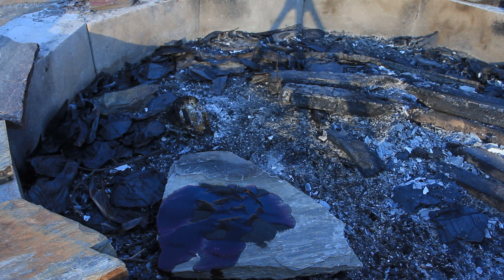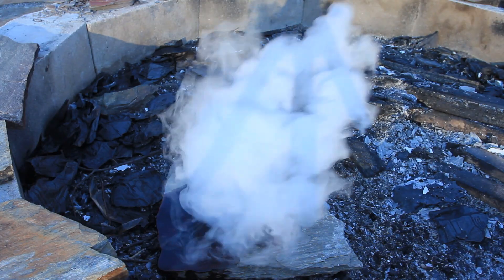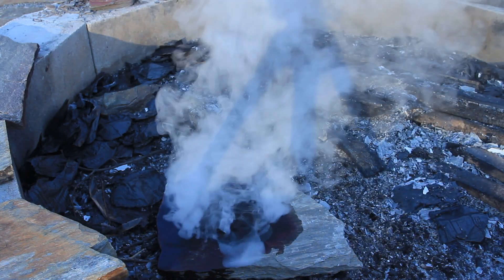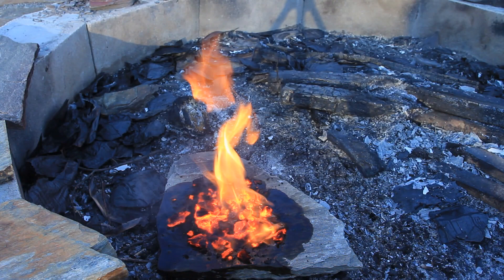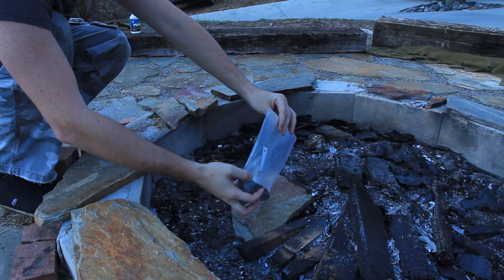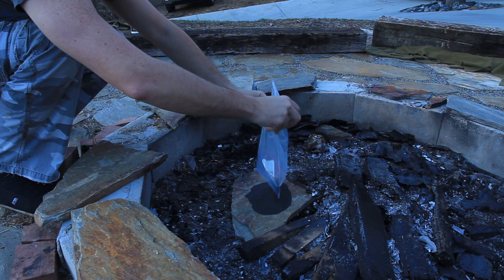Let's see what happens. And we got the explosion. Here I have almost a pound of potassium permanganate.